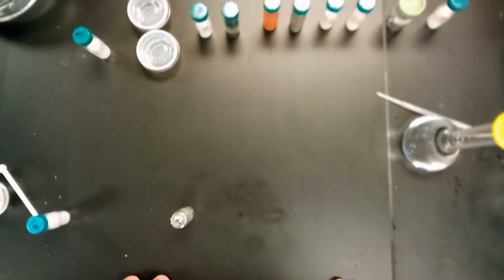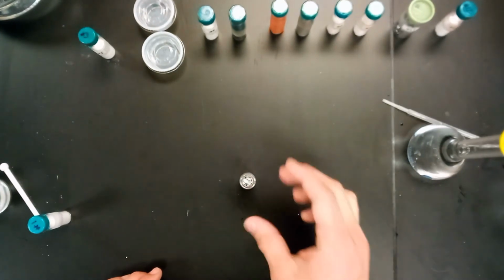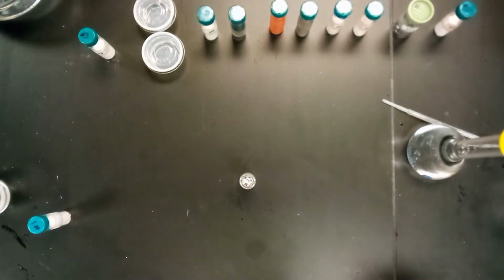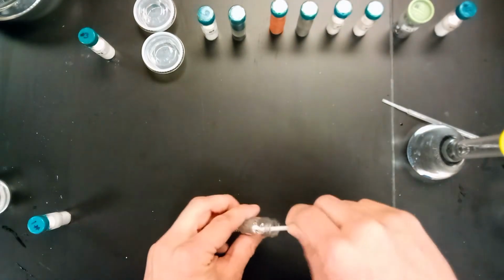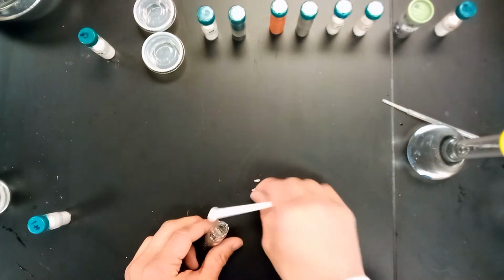So we're done with number 1, so we'll just set it off to the side. And we've actually got number 2 here now. It's a metal, it appears. So go ahead and maybe get one of these pieces out, or a few of them.